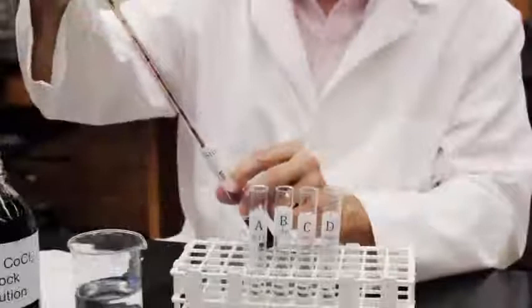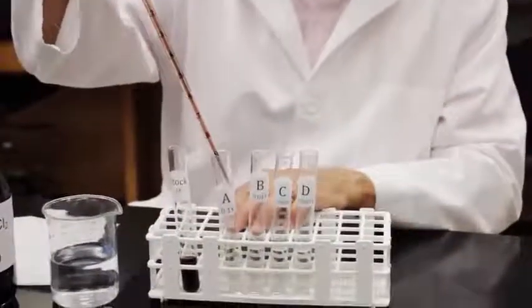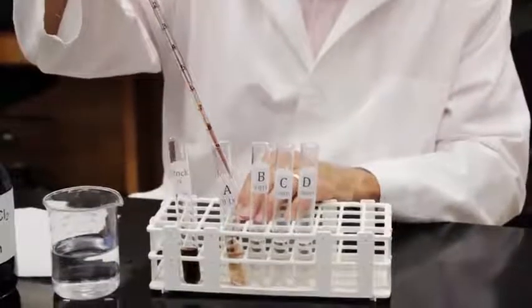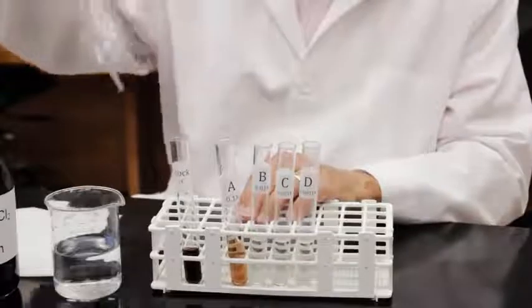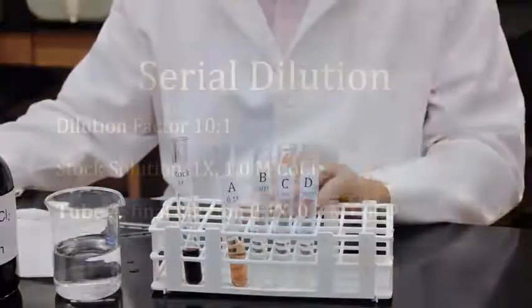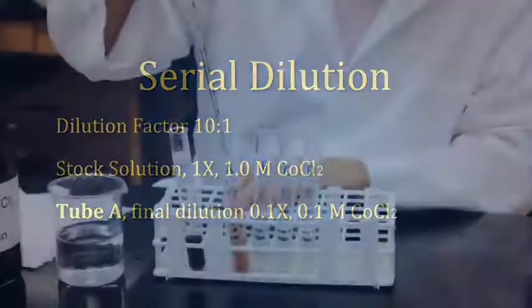Now use a clean pipette to transfer 1.0 milliliters from stock 1X tube to tube A. Don't submerge the tip of the pipette in tube A. Mix the contents of tube A. Tube A now contains 9 milliliters of water and 1 milliliter of 1X stock solution. The final dilution for tube A is 0.1x, producing a 0.1 molar cobalt chloride solution.